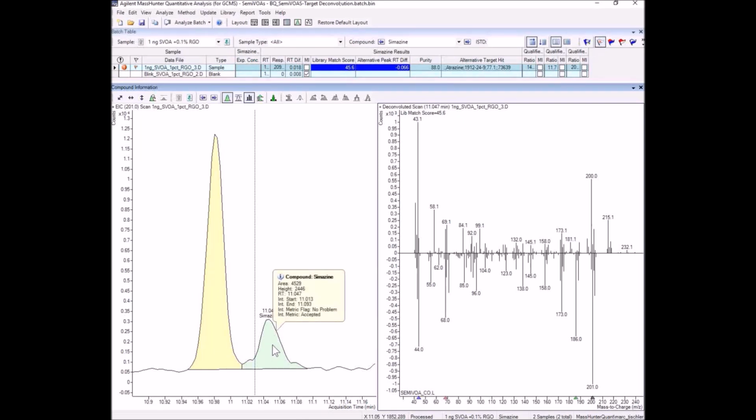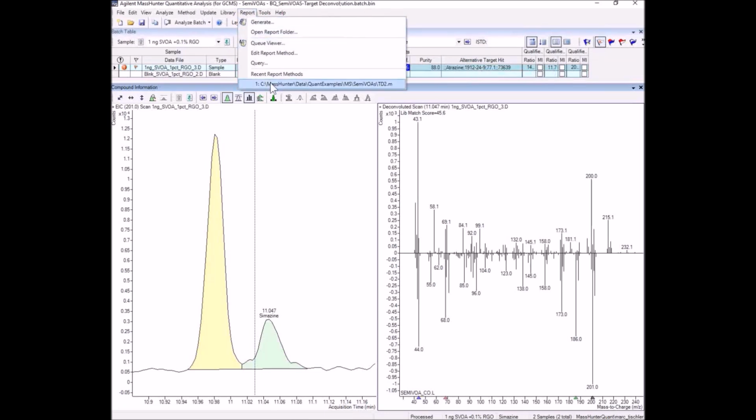All right, for the demo, let's take the case of simazine, which we already know is a false positive. When searched against the NIST library, we're going to find out that it finds a better library match score, atrazine, a very related compound. It puts that information into this column, alternative target hit, as you've seen here. So let's take a look at generating the report.